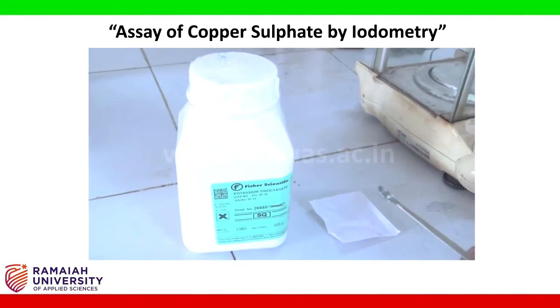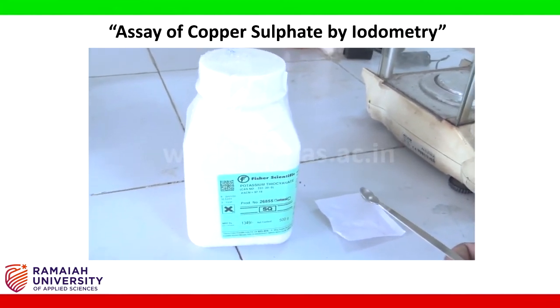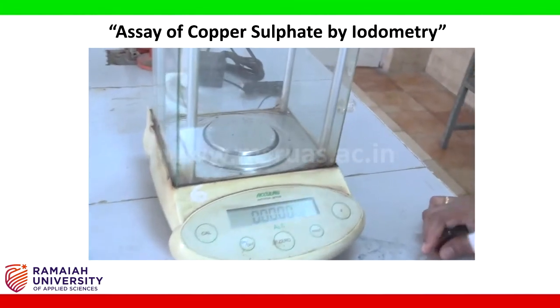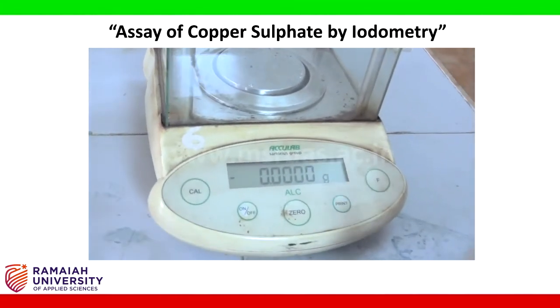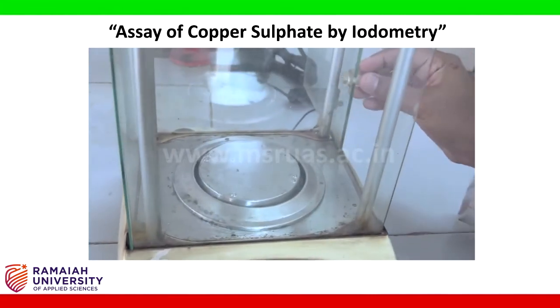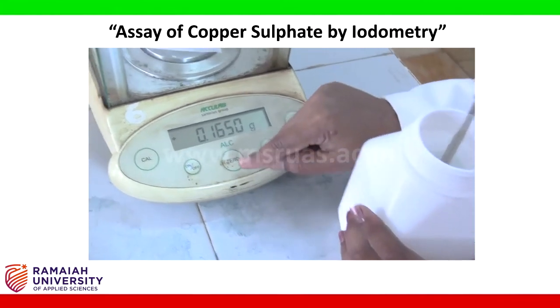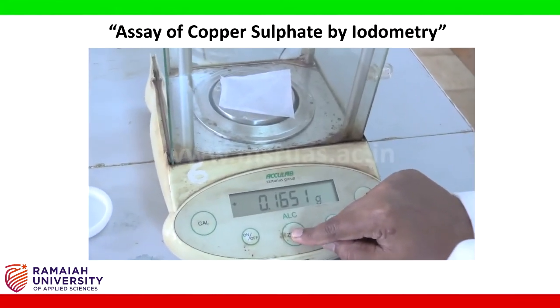Using butter paper, weigh 1 gram of potassium thiocyanate. Tare the balance to 0. Keep butter paper. Tare the paper weight to 0 grams.